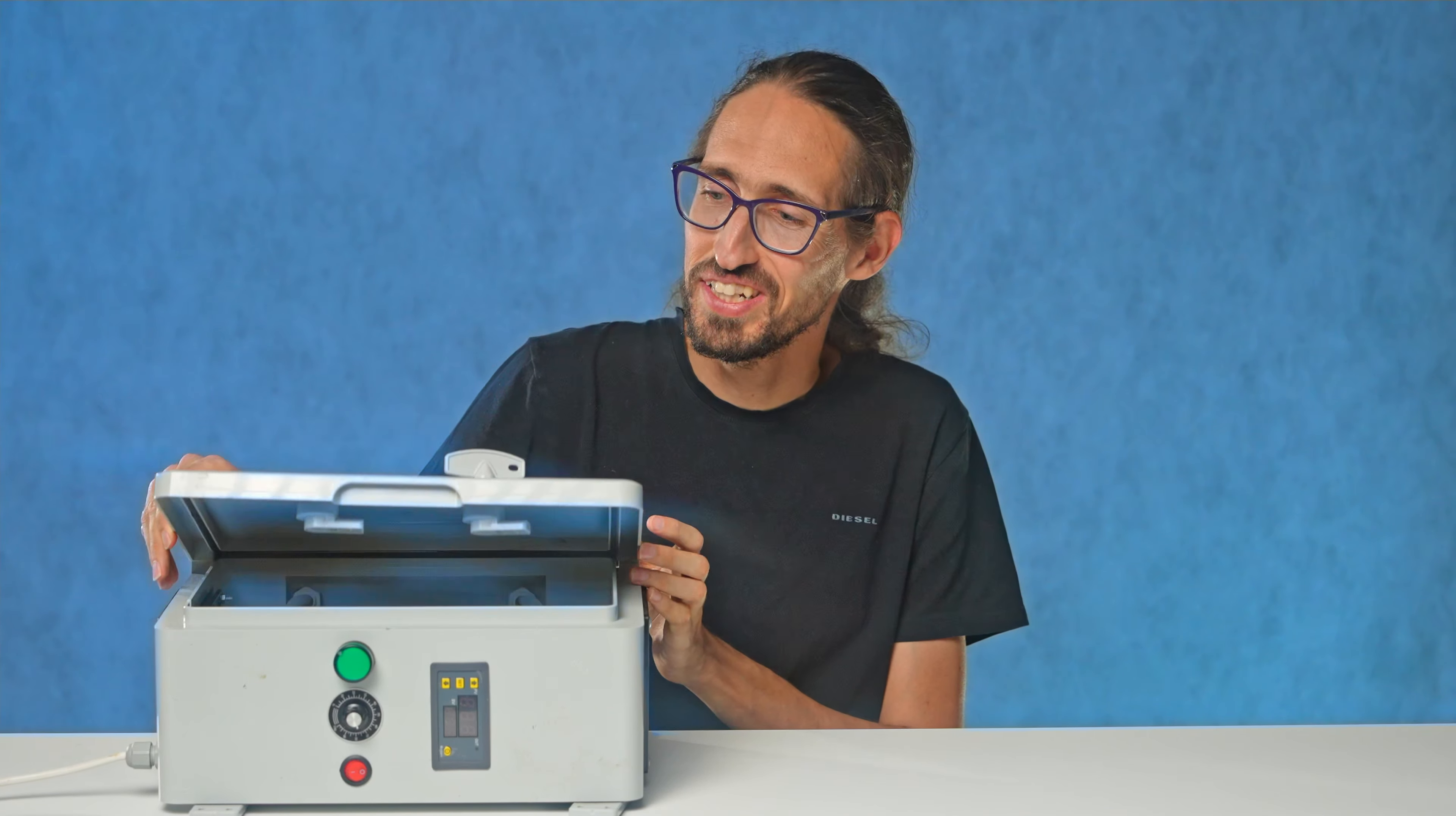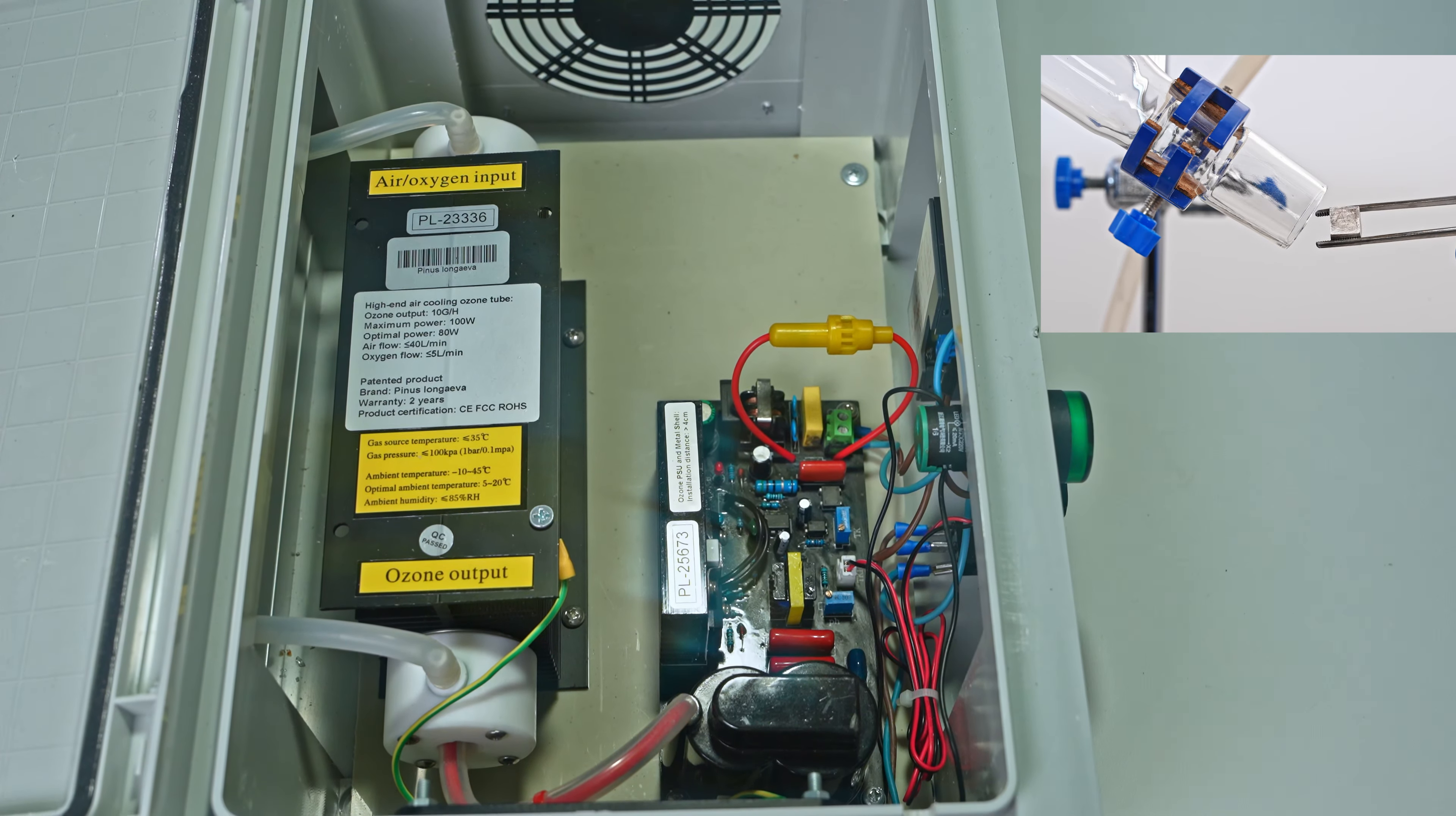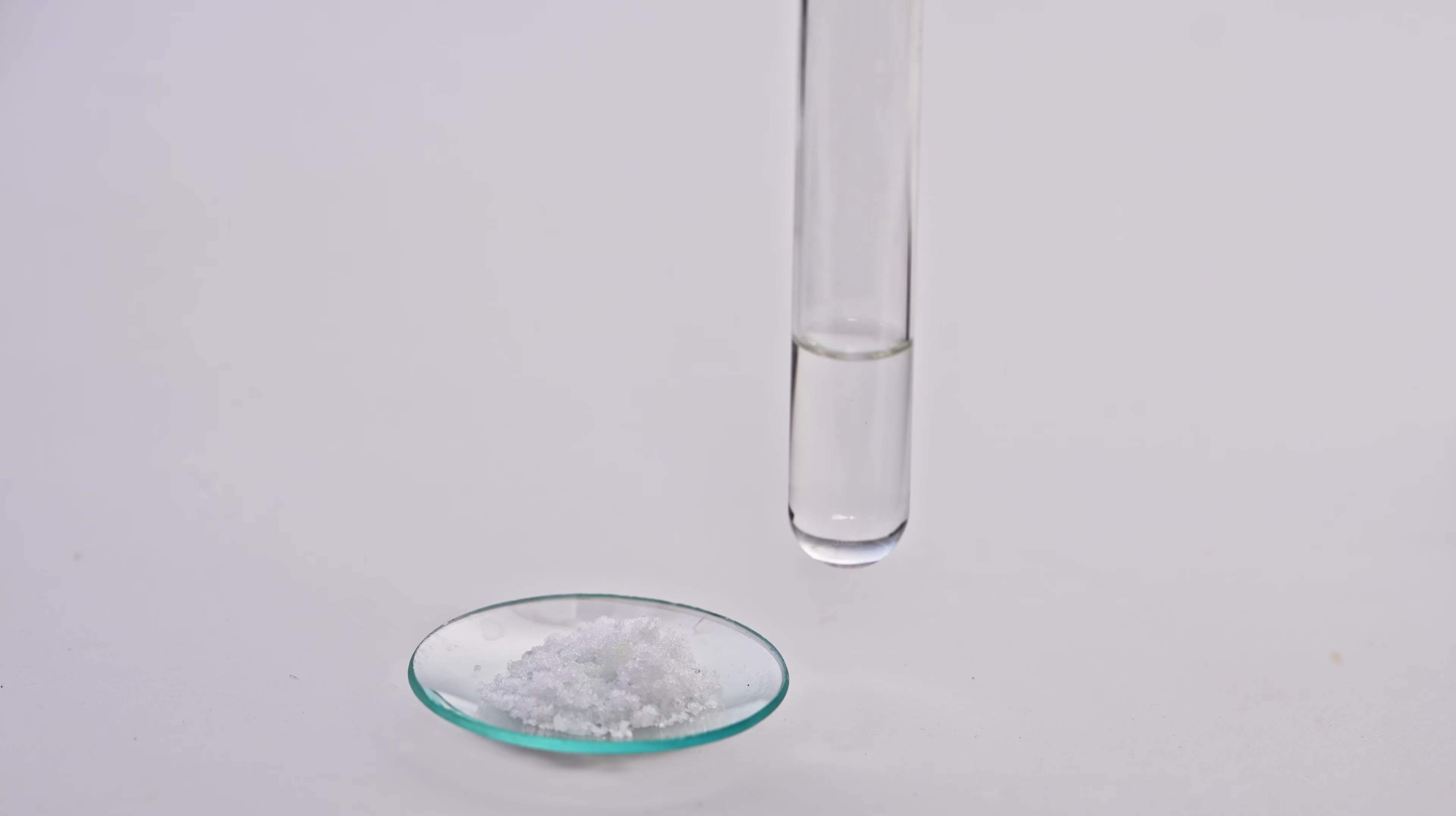I generated the ozone using my new ozone machine, which produces 10 grams of ozone per hour. Currently, I'm working on a larger video about ozone, but I wanted to showcase some reactions separately like this one. I also plan to make individual videos about the reaction of hydrazine with ozone, and another one on potassium ozonide. All of this is made possible thanks to the support of my dear patrons, so if you can, consider joining them.